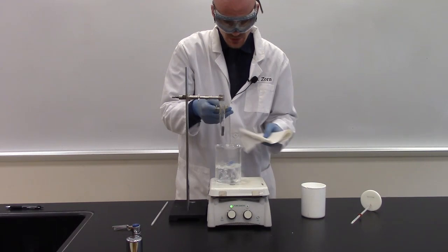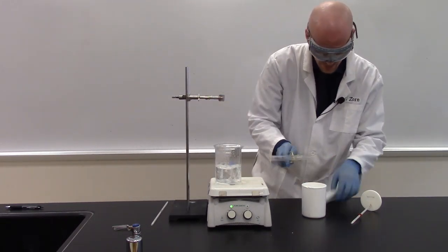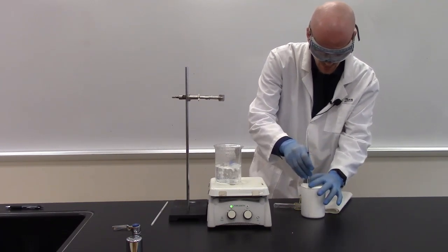I'm also going to use a paper towel so I'm not dropping any of the water in the process. And then I'm going to put the lid on as quickly as I can.